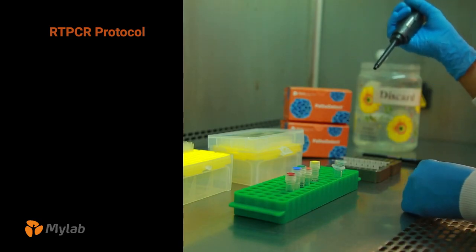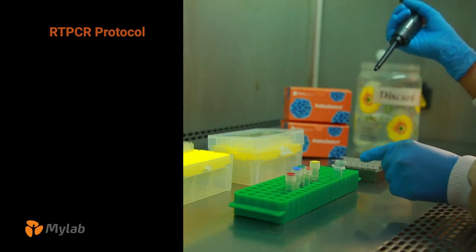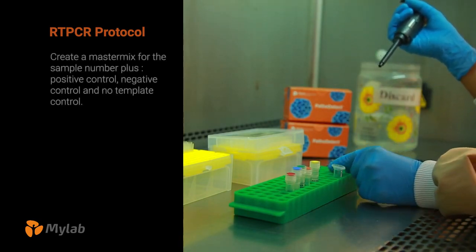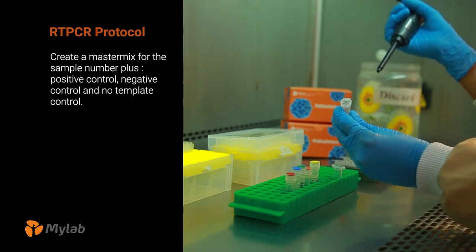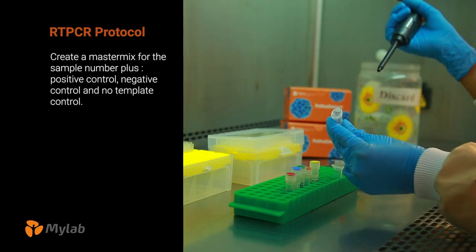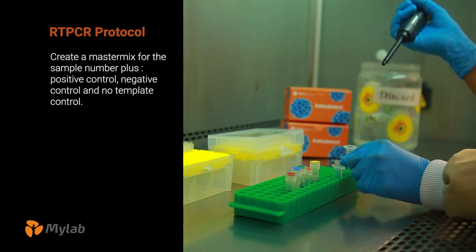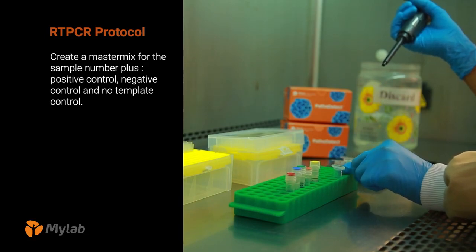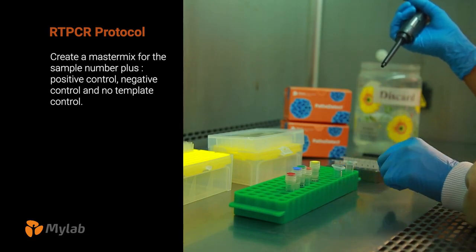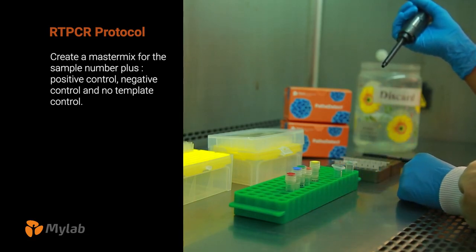For PCR identification, you create a master mix for the sample number, plus a positive control, negative control, and no template control.